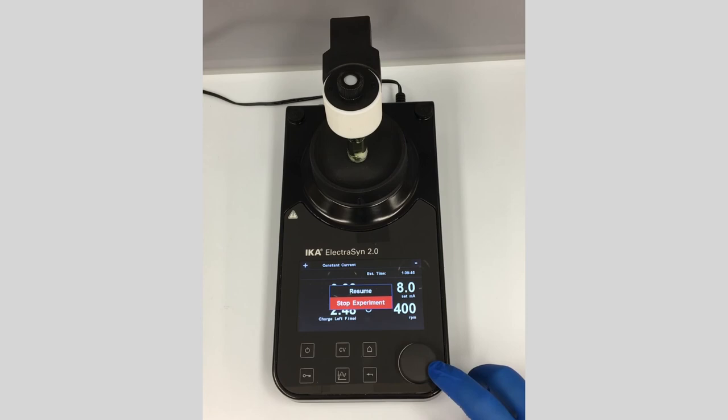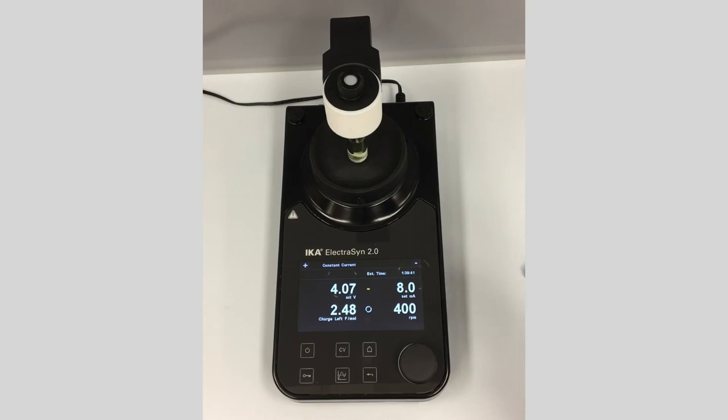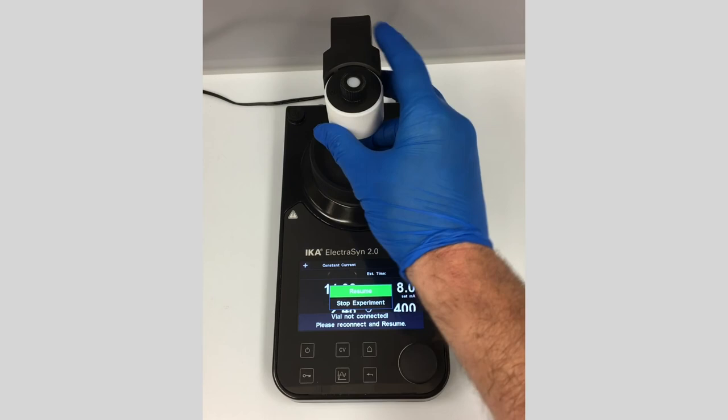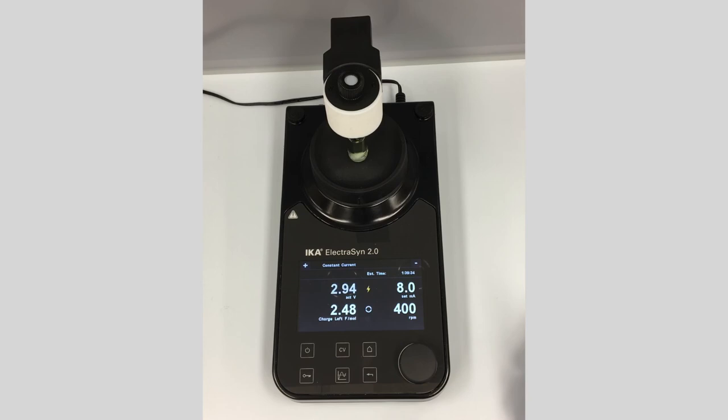Another useful feature: if you pull out the reaction vial to take an aliquot for TLC, the device detects that the vial has been removed and stops the experiment. When you place the vial back in and click resume, it picks up right from where it left off.